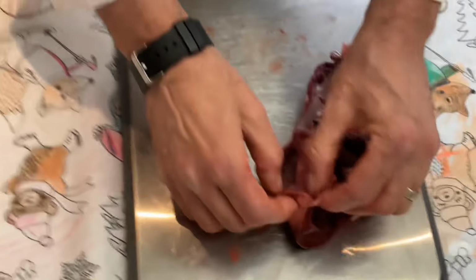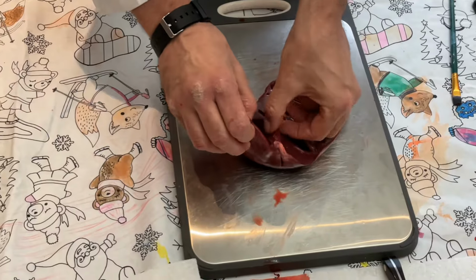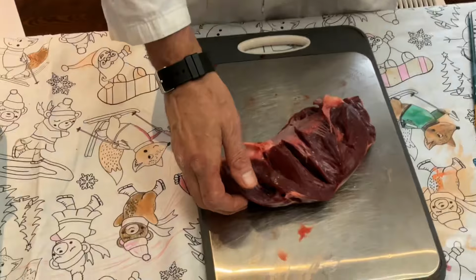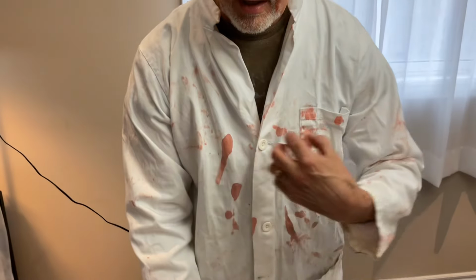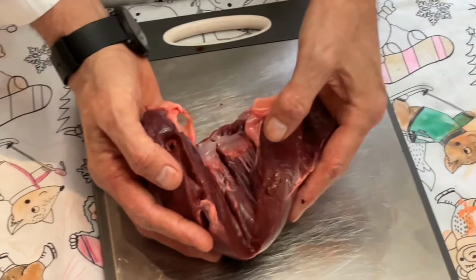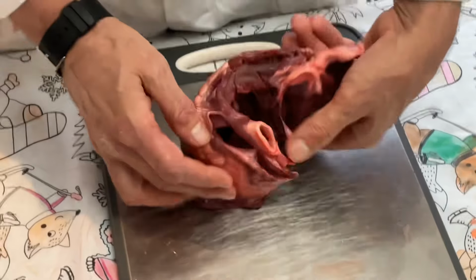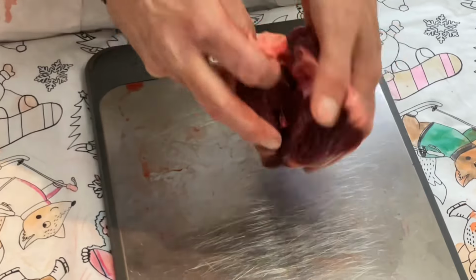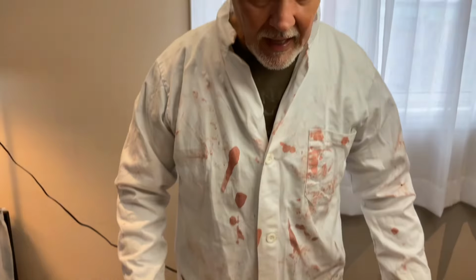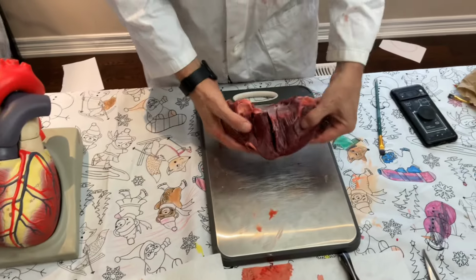Well, why is that? Because in the atrium, you only have to push the blood this far, right? The blood coming out the right side of the heart, with a little bit thinner walls of muscle, only has to push the blood to the lungs. That's not very far. I'll show you on my body, right? Heart's here, lungs are here. That's not very far. But look how much thicker the muscle is on the left side. That's because when the blood pushes out of the aorta, which is right up here, it's got to travel all the way through the body and have enough pressure to make its way back.